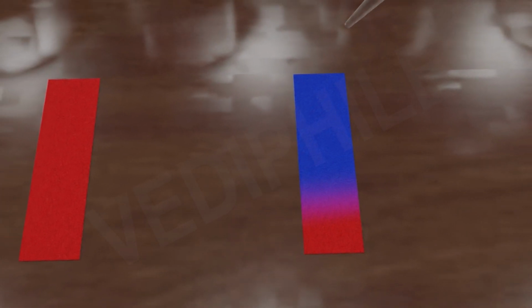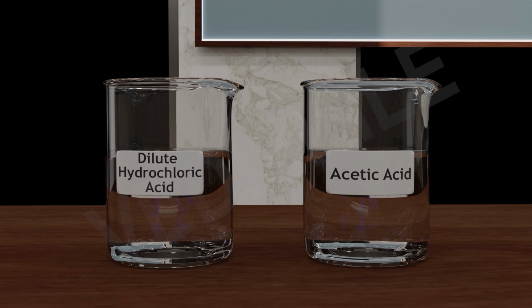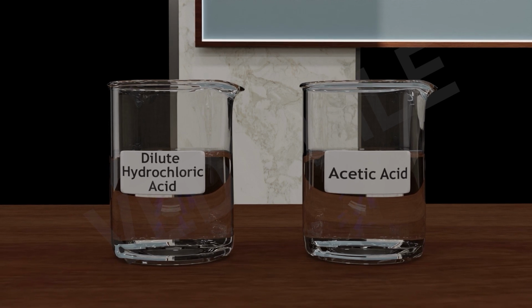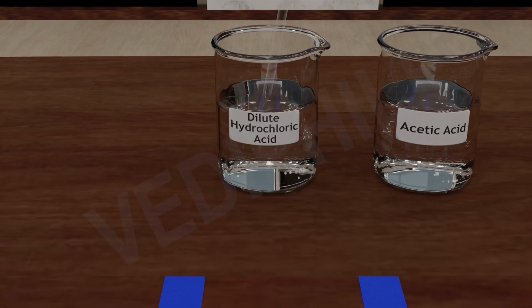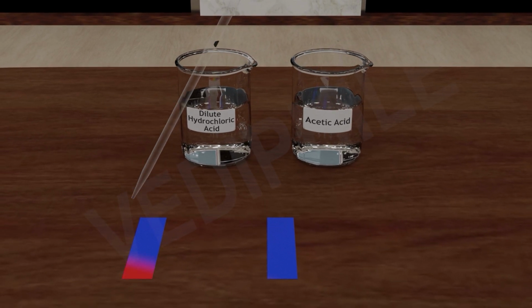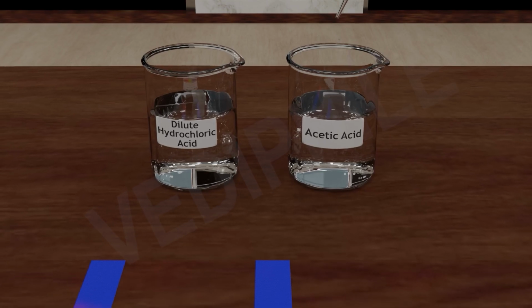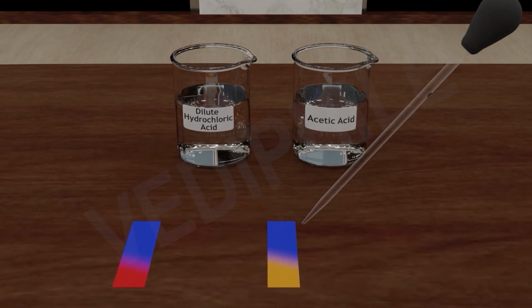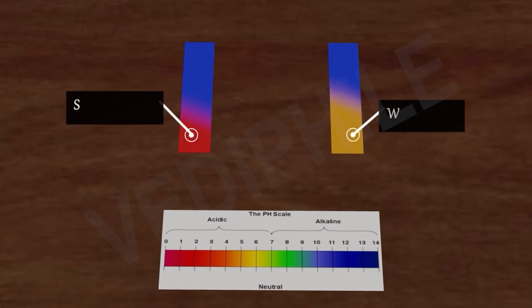So the litmus test can indicate both dilute acetic acid and dilute hydrochloric acid as acids, but it cannot distinguish their relative strengths. However, the universal indicator reveals that dilute hydrochloric acid is a stronger acid compared to dilute acetic acid based on the pH values observed.